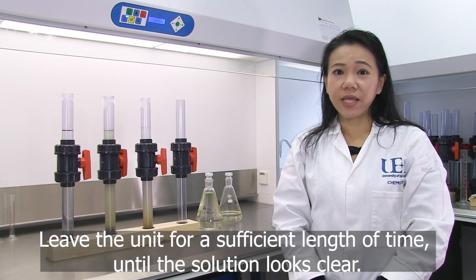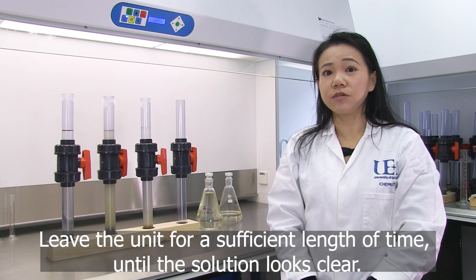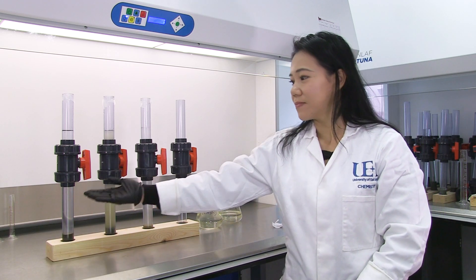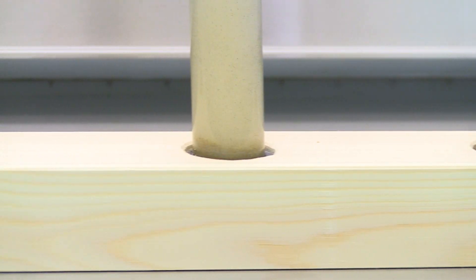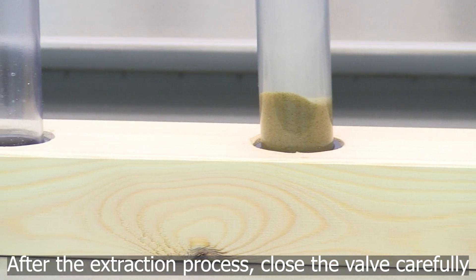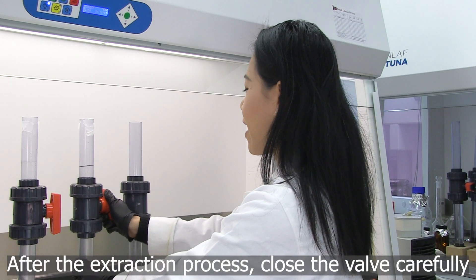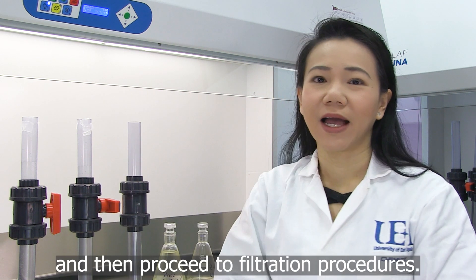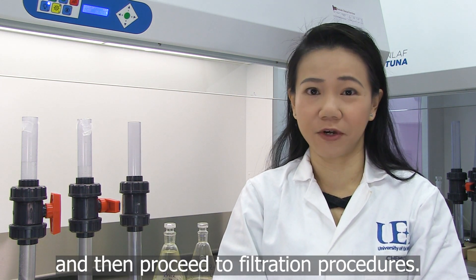Turn the unit upside down to mix your sample with the solution. Leave the unit for a sufficient length of time until the solution looks clear. After the extraction process, close the valve carefully and then proceed to the filtration procedures.